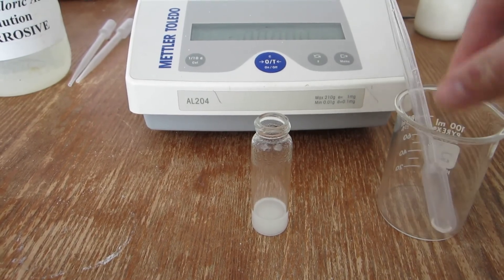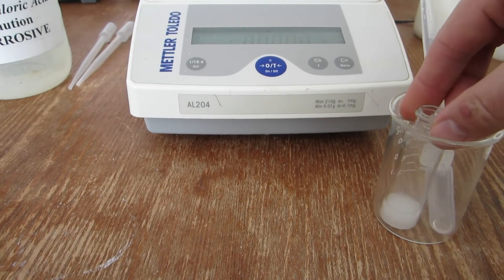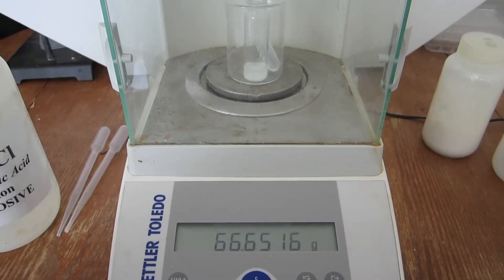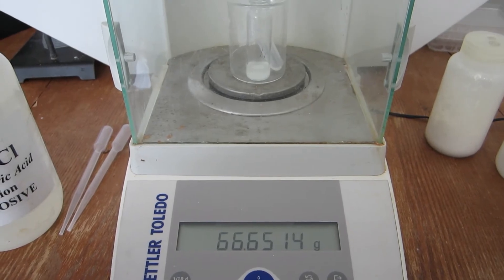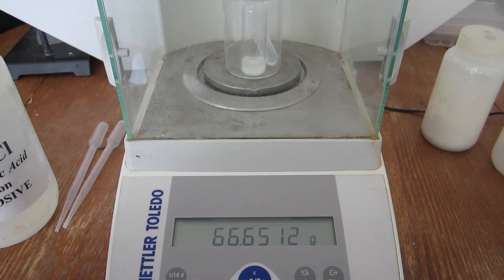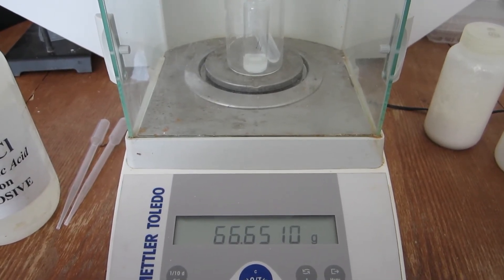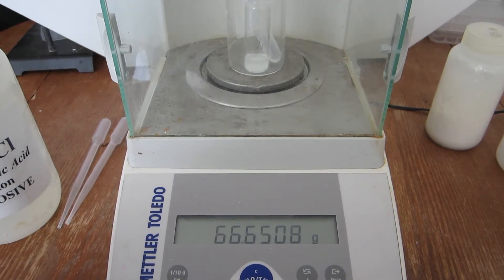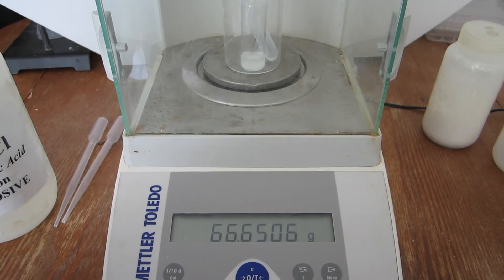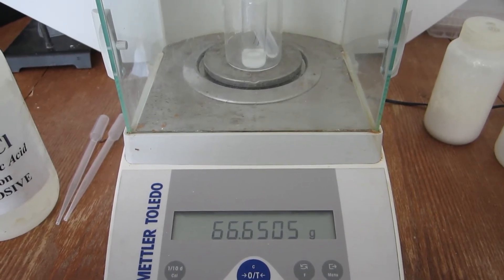After the reaction is finished, the combined mass can be recorded. The combined mass of the sample, vial, acid, and beaker is displayed. This is the mass after the reaction. The difference in mass between before and after the reaction is the mass of carbon dioxide that was lost during the reaction.